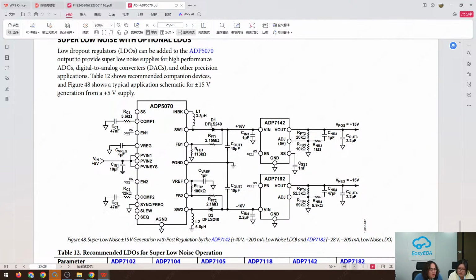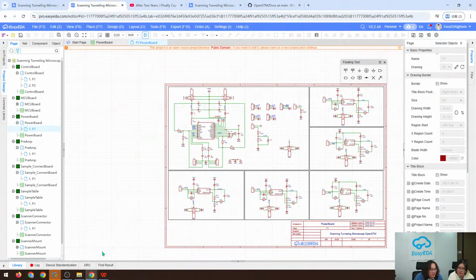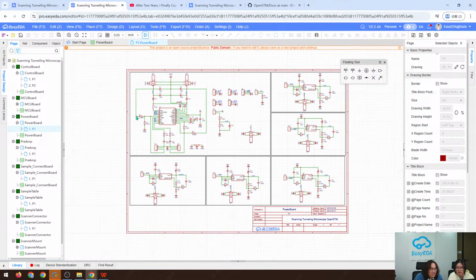So maybe we can draw this schematic with EasyEDA. It's just a quick demonstration, and we may not have enough time to cover the whole workflow, but we can demonstrate some functions of EasyEDA.